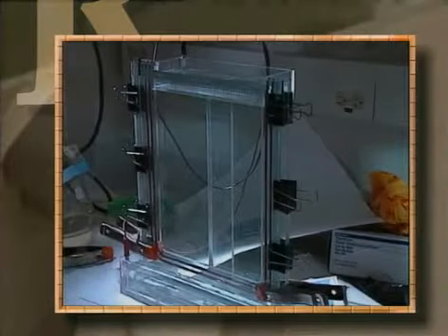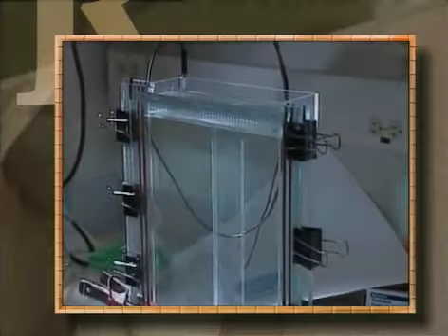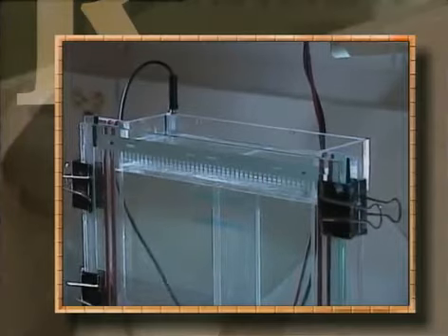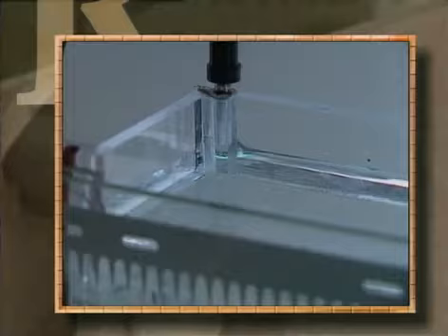To grave unnecessary risk. And it's possible to continue using older or homemade devices without protective features. It's also possible to run an electrophoresis device unattended. But none of these are exactly what's meant by practicing safe science.